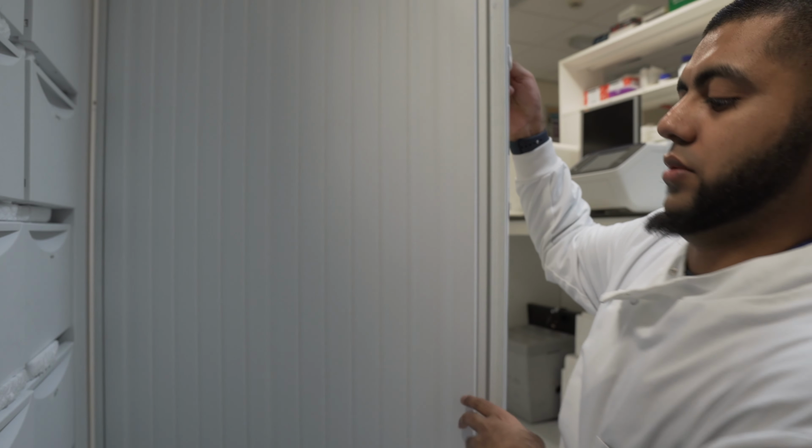So that's my actual lab bench over here, or drawer over here. Let's go to my other drawer just to show you some of the samples that I actually have. So guys, we're back in the other lab. It's going to show you now the other drawer that I have and some of the things that I have in this drawer.